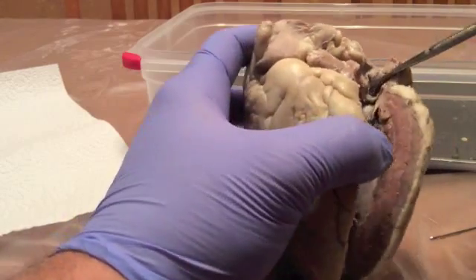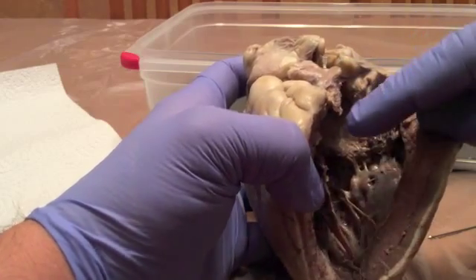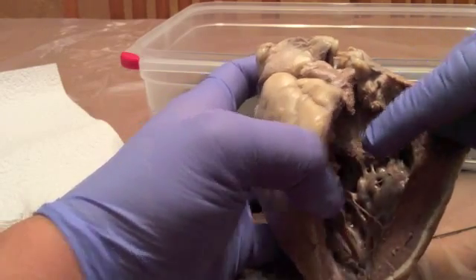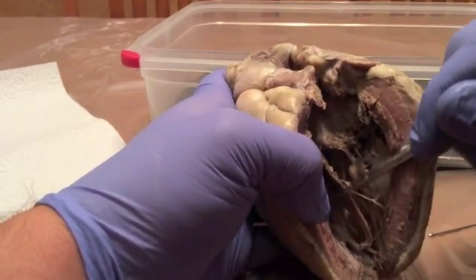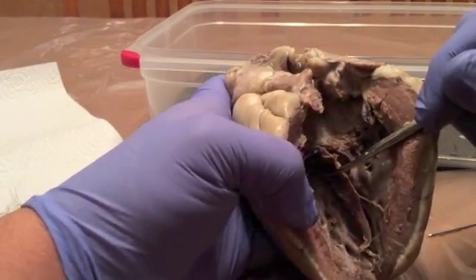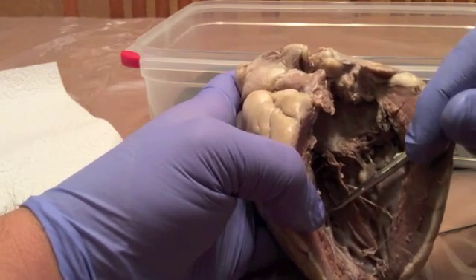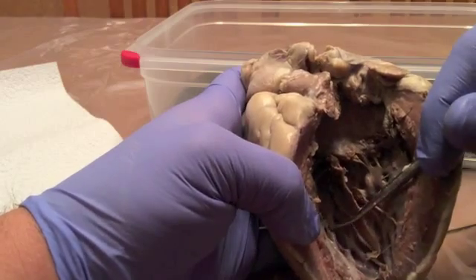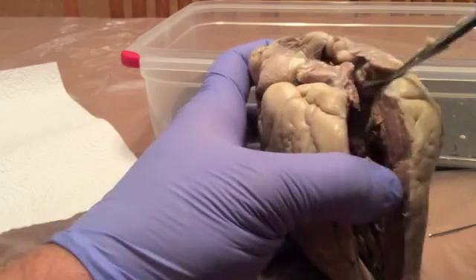Got the same atria, the same as the right-sided, and you can see the interior lining is a lot more bulkier due to the purpose. We've got the papillary muscle, which is here, and then we've got the different valves that are going to lead up and out.